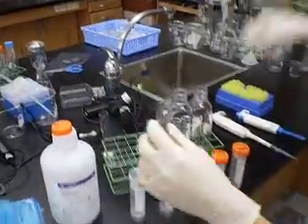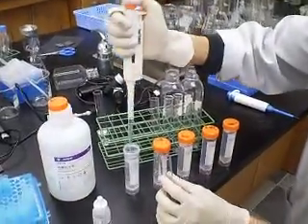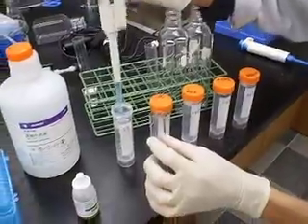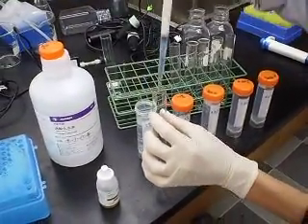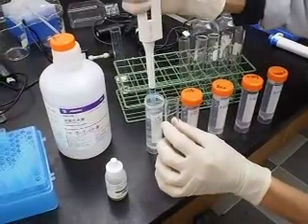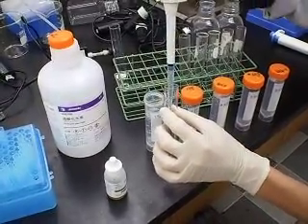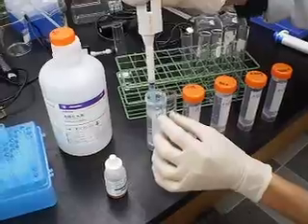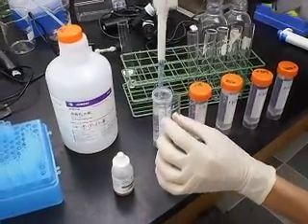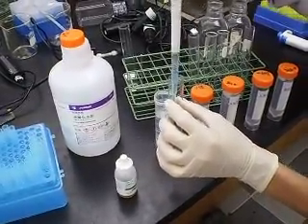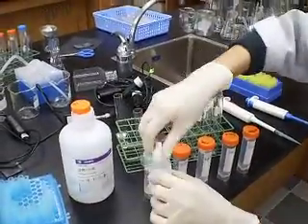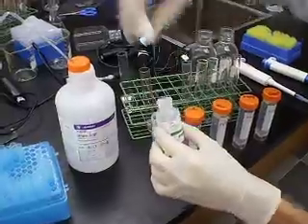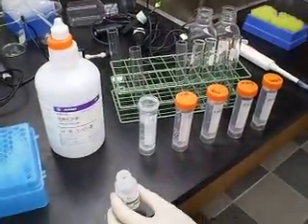So this is done. I'm going to add about 5 mL into this test tube. 1 mL, 2, 3, 4, 5 mL of hydrogen peroxide. Add the enzyme which is catalase.